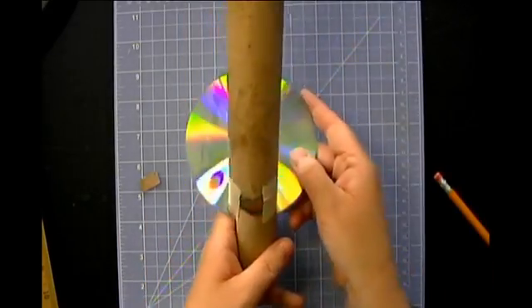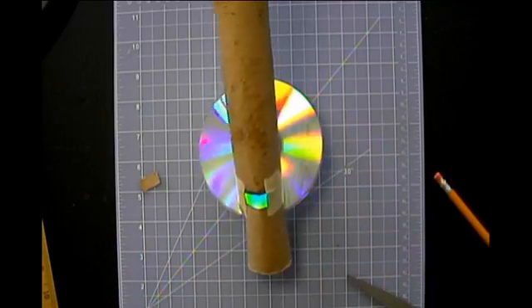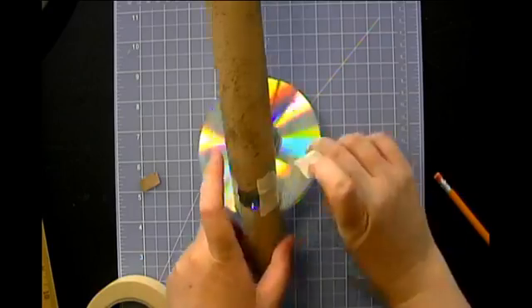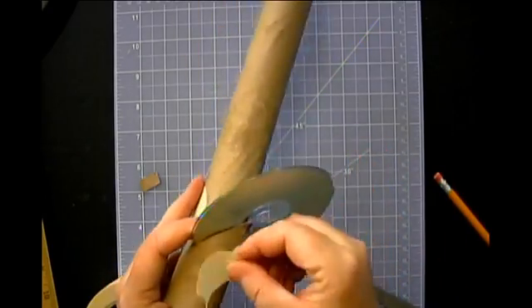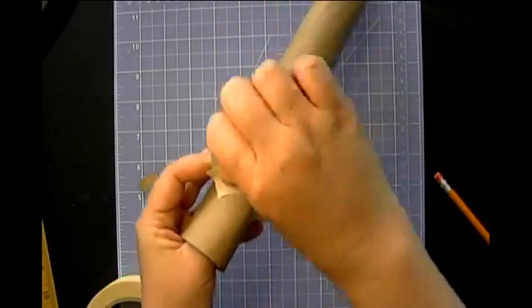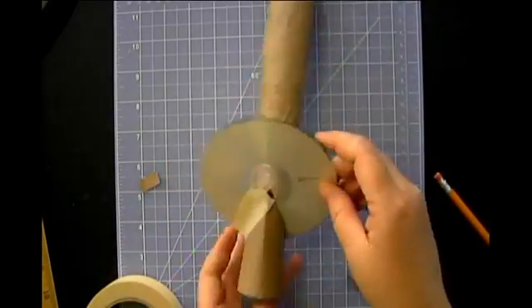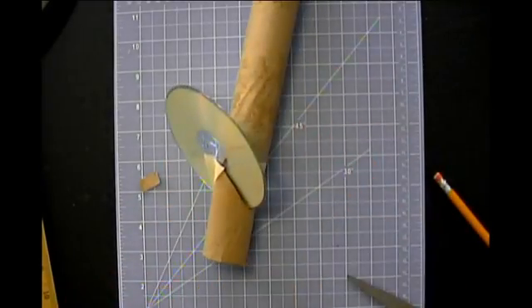All right, so I've got that in, and now I'm just going to take a bit of tape, and this is totally optional. If you feel comfortable using hot glue, you may decide instead to use hot glue for this part. But a little bit of tape on the back here, just to make sure everything stays in place so it doesn't fall out like mine was before.